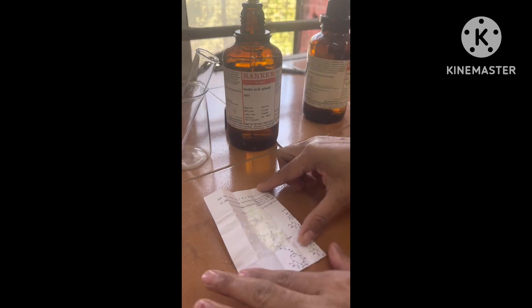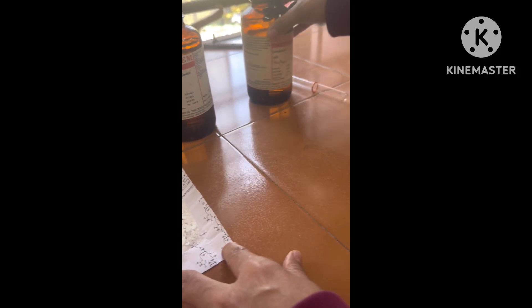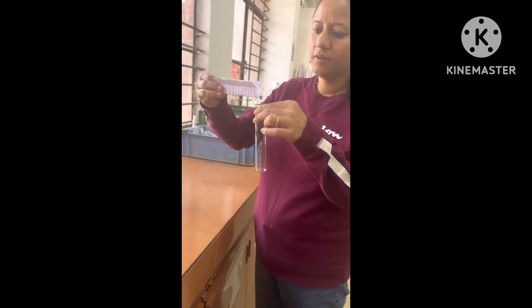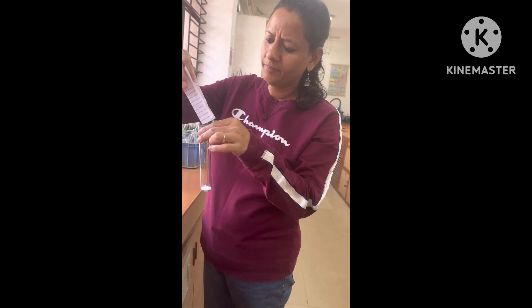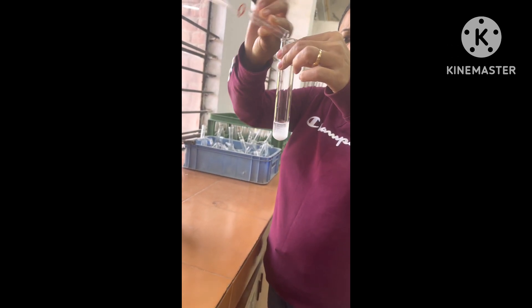First of all, we have taken one gram of benzophenone, which is a white solid. Isopropanol and acetic acid were also used. One gram of benzophenone is taken in a boiling tube, then approximately 10 ml of the solvent isopropanol or 2-propanol is added.